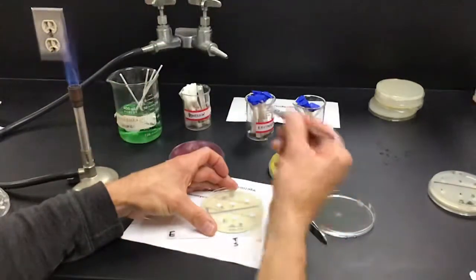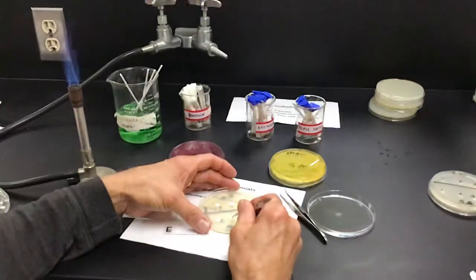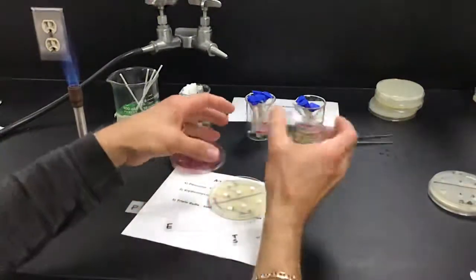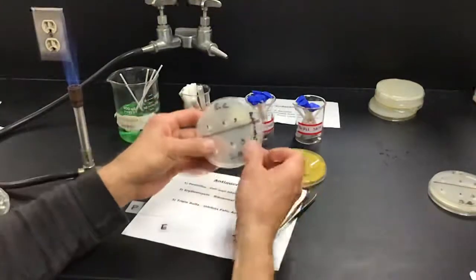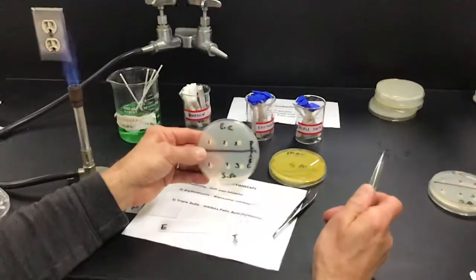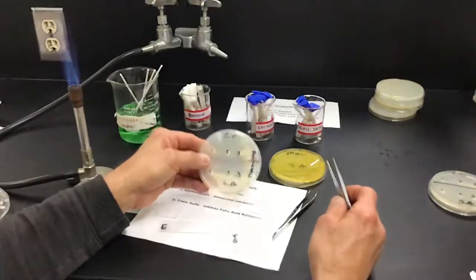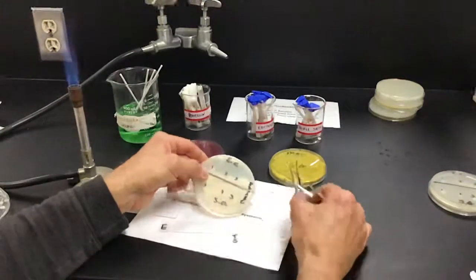And once again, we want to make sure these are seated, but like I told you guys, don't Wolverine these. They don't have to be jammed in there. And we will check the effectiveness of this on Monday, and I will post the results in lecture and lab, and we'll make a little video showing the results. We can measure the zone of inhibition, and we'll see how we made out. All right.